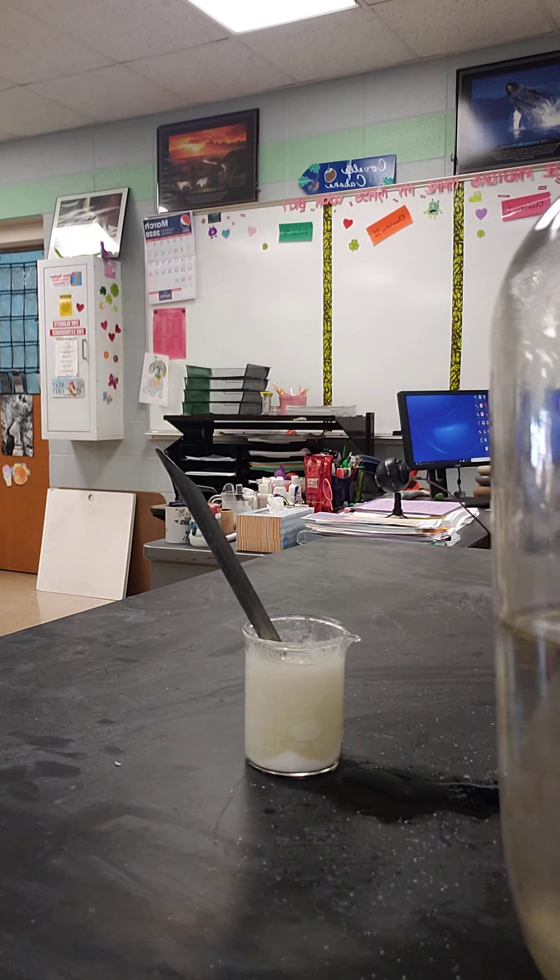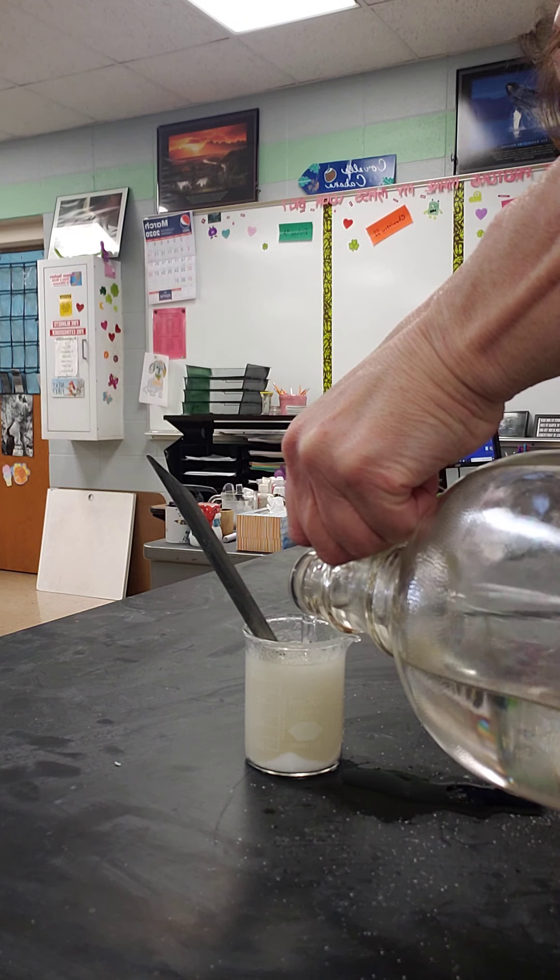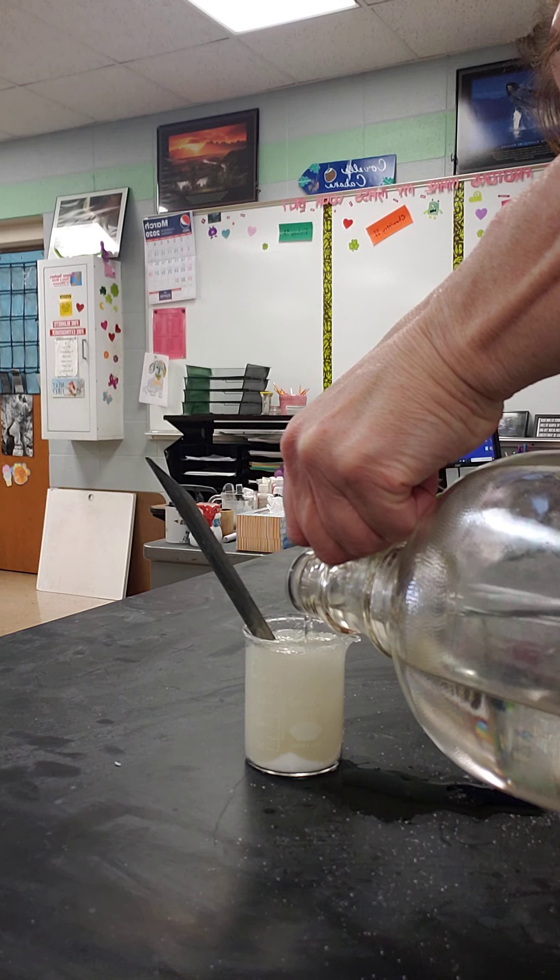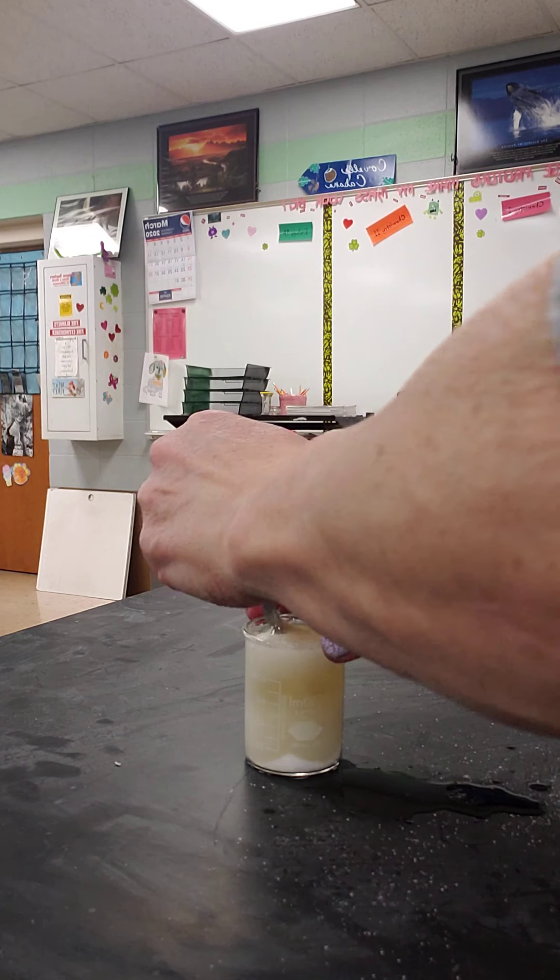Here's the sulfuric acid. Pour this in. And then I'm going to stir it up.